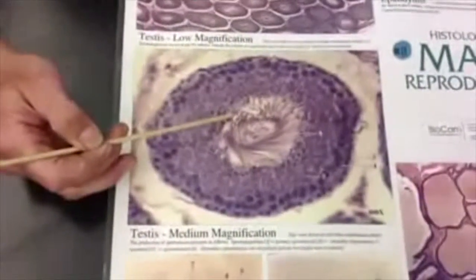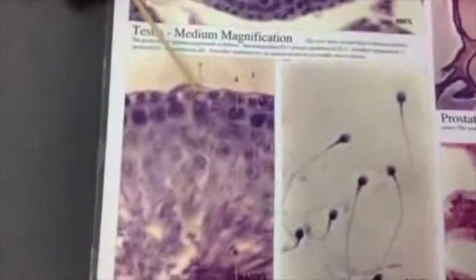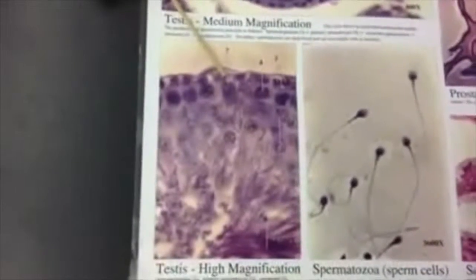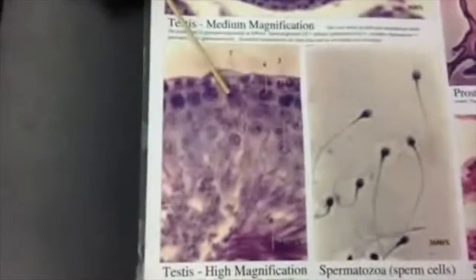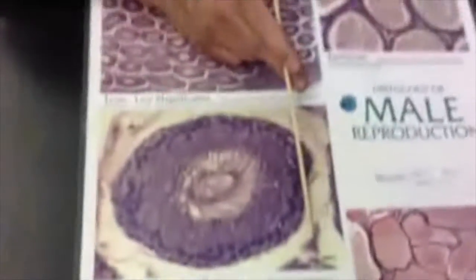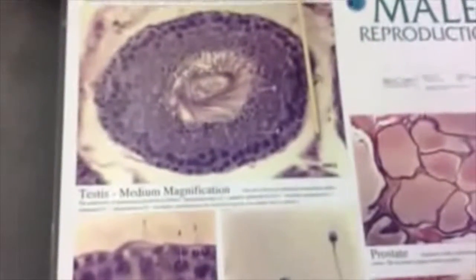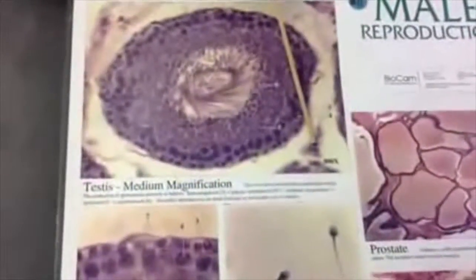But then you have cells which are different looking, like number 7. That's a nurse cell or Sertoli cell, sustentacular cell. They help feed and nourish the other cells. The other ones that are different are the ones that are not in the circle. These are interstitial cells, also known as Leydig cells, and they make testosterone. So these make sperm, these make testosterone.